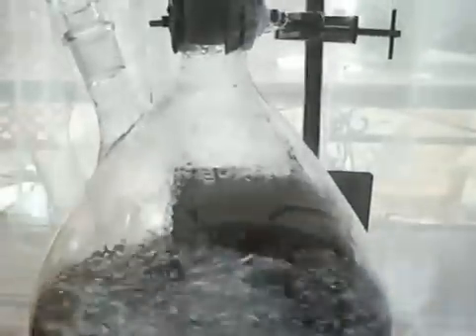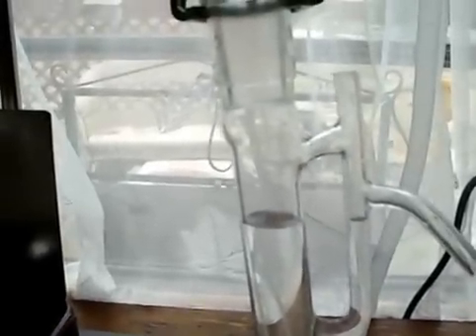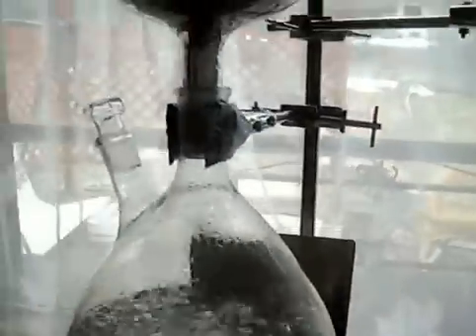You can see the condenser is filling up with water. As this is filling, I'm going to have to raise the boiler. You can see in the biomass flask there is some condensation coming back down into the boiling flask, and I want it to travel all the way through to the still head and into the condenser. Some of it is — we are already getting a steady amount coming into the condenser, but I want to improve the efficiency.